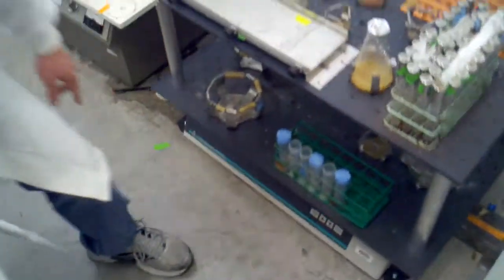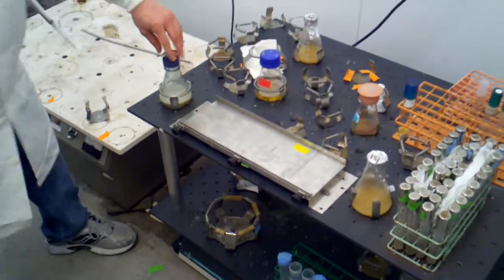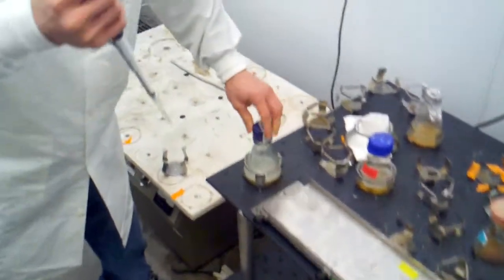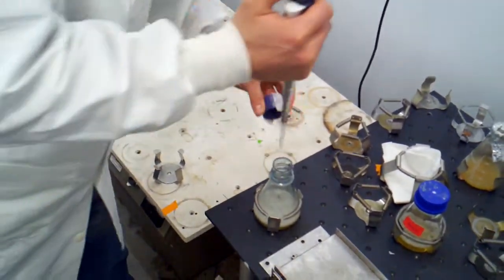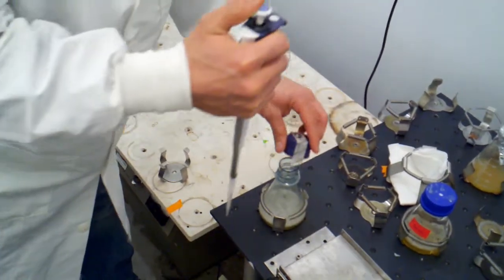So I'm going to turn off the shaker, open up my beaker, and inject. And that's it.